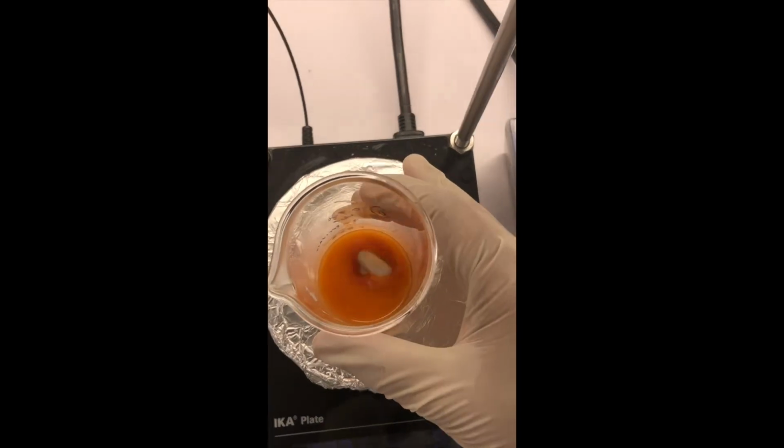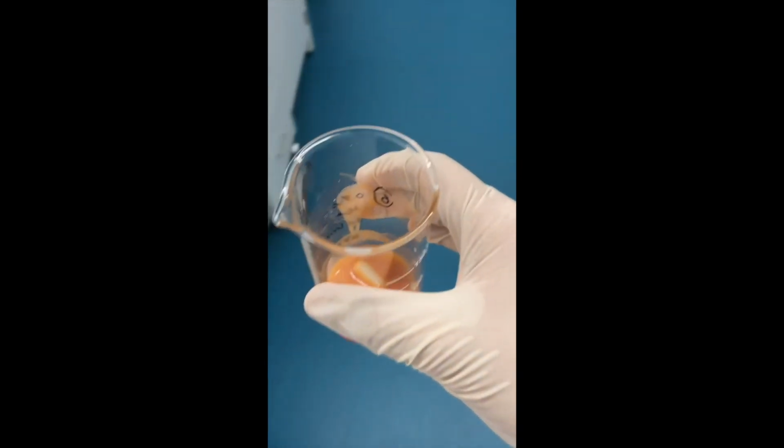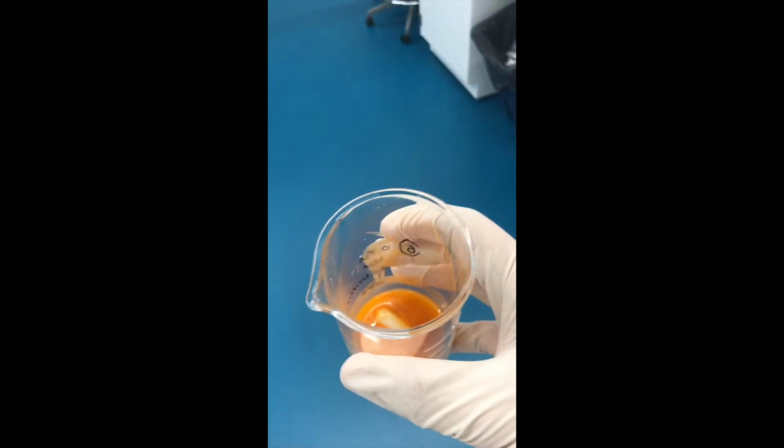And then finally, after roughly 45 minutes, the sample is all mixed up. And as you can see, it turned bright orange because the fluorescent dye water solution mixed it nicely. And now finally, it's time to put it on a microscope slide so that I can image it. So this is just a clean, sterilized microscope slide. I don't want it to be too dirty.